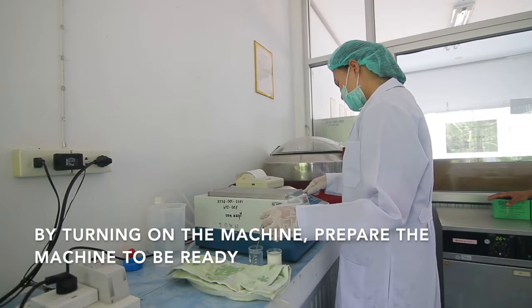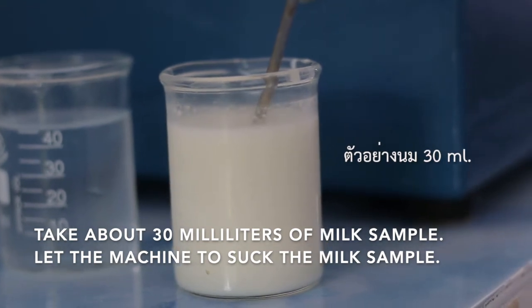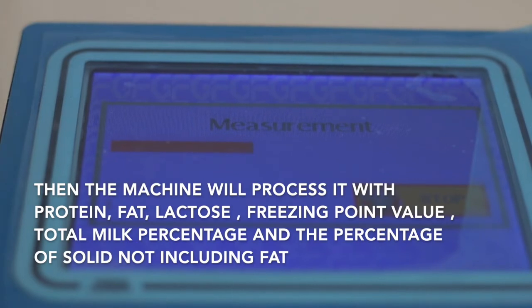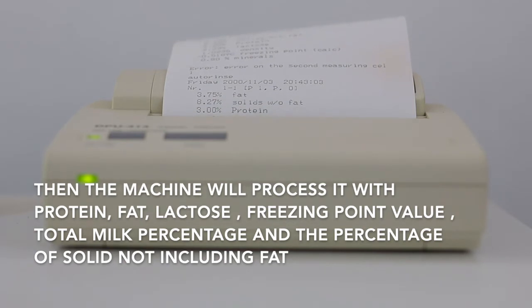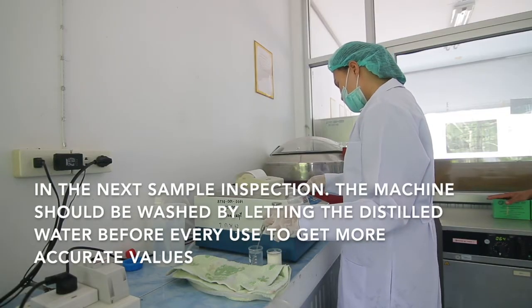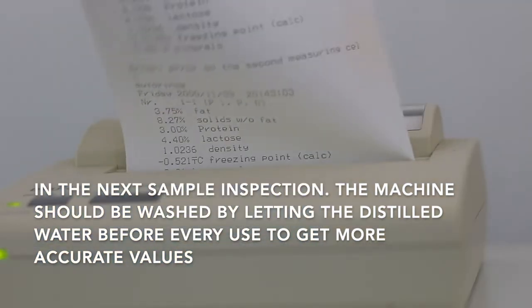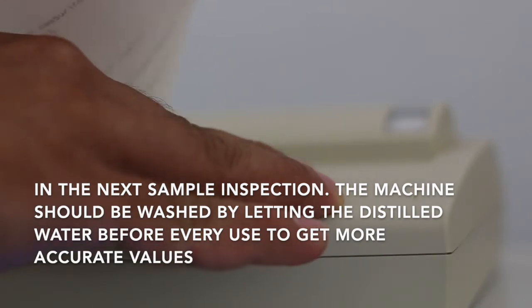By turning on the machine, prepare the machine to be ready. Take about 30 ml of milk sample. Let the machine suck the milk sample. Then the machine will process protein, fat, lactose, freezing point value, total milk percentage, and the percentage of solids not including fat. In the next sample inspection, the machine should be washed with distilled water before every use to get a more accurate value.